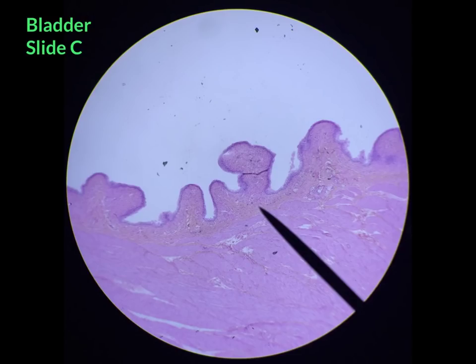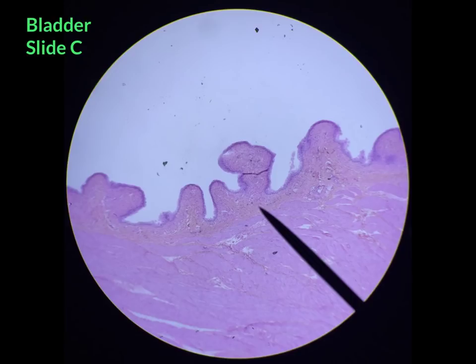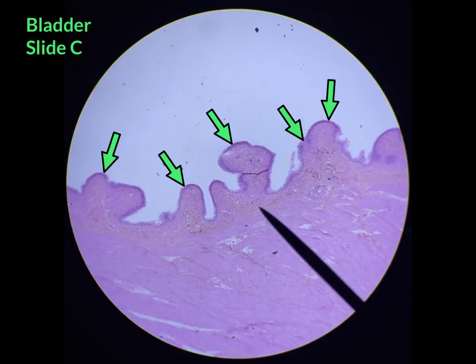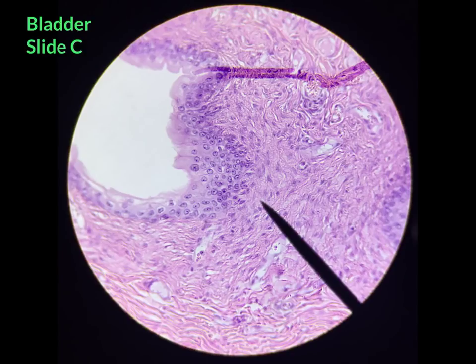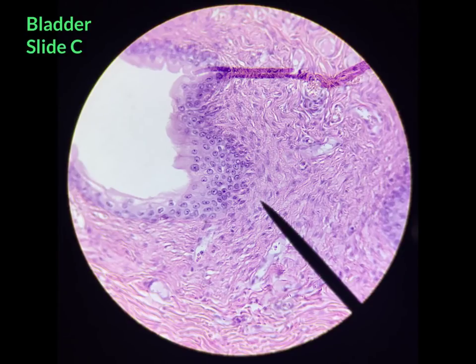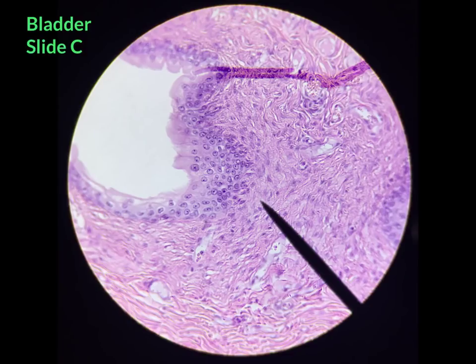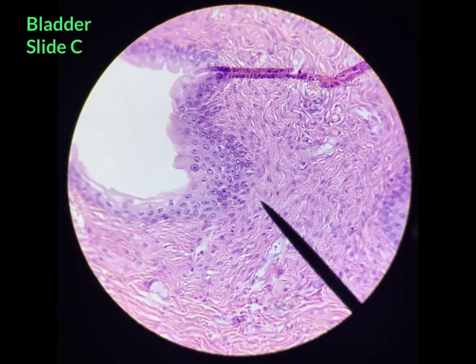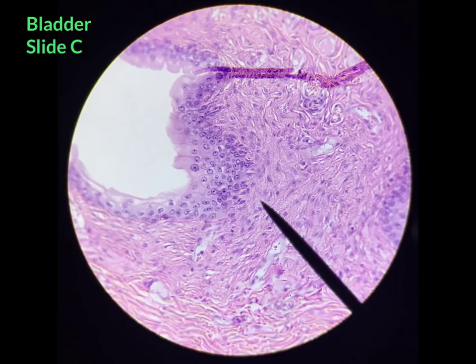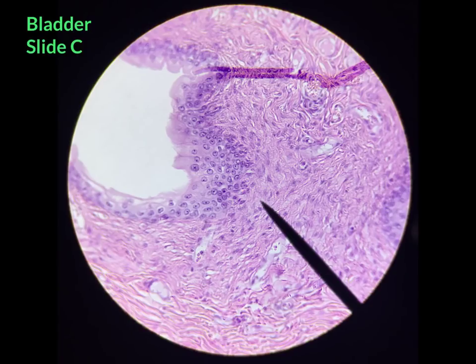The last epithelial tissue we will identify is transitional epithelial tissue, which can be found in the bladder on slide C. When searching for it, look for the purple area closest to the white area. Under high power, the epithelial cells resemble cuboidal cells stacked on top of one another, giving the appearance of being stratified — so it can sometimes be categorized as stratified cuboidal. We call it transitional epithelial tissue because when the bladder becomes distended, these cuboidal cells stretch and change shape into squamous cells, transitioning from cuboidal to squamous.